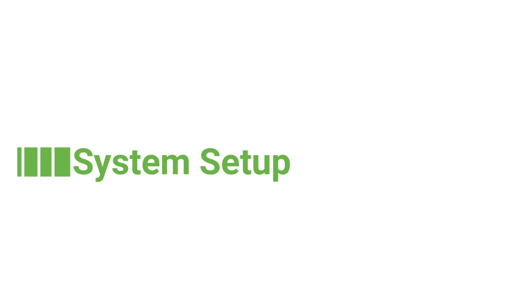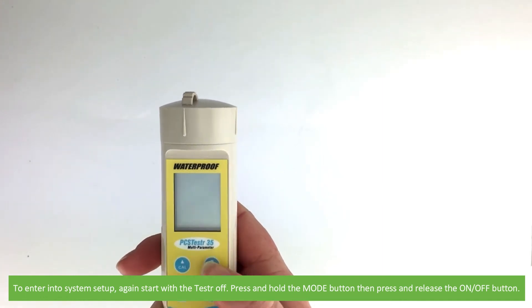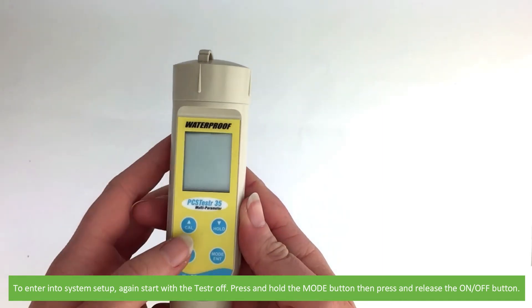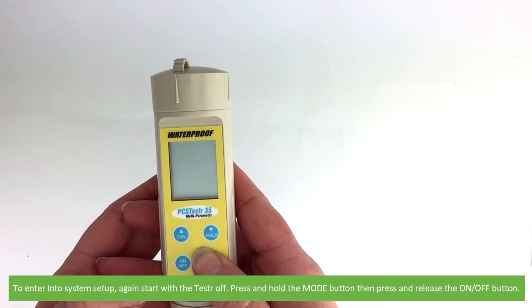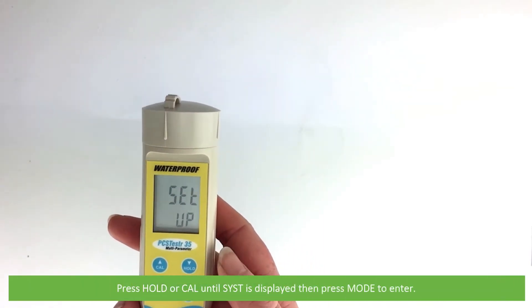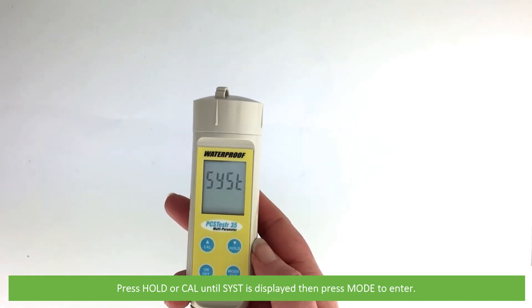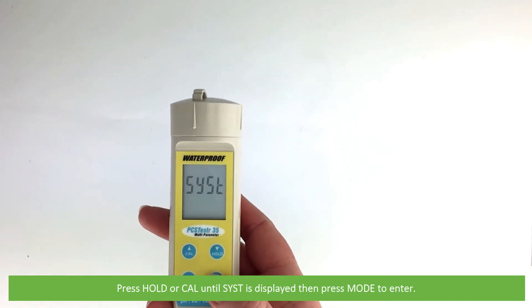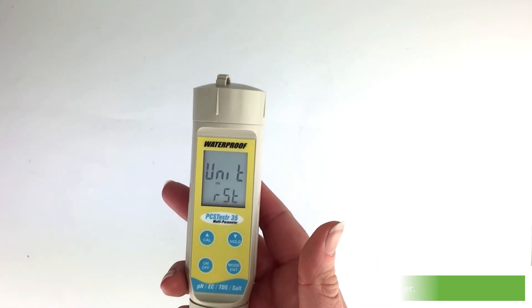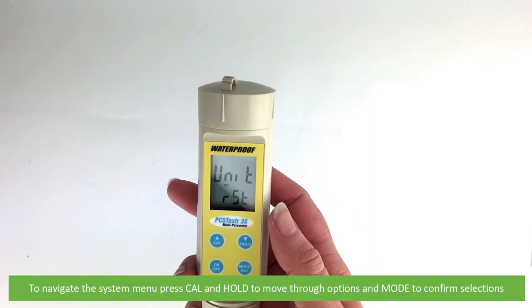On to system setup. To enter into system setup, again start with the tester off. Press and hold the mode button, then press and release the on-off button. Press hold or cal until SYST is displayed, then press mode to enter. To navigate the system menu, press cal and hold to move through the options, and mode to confirm the selections.